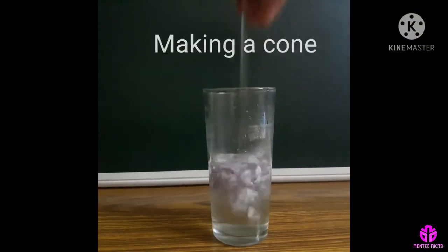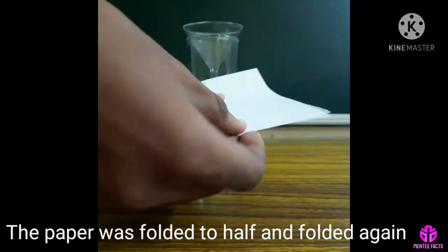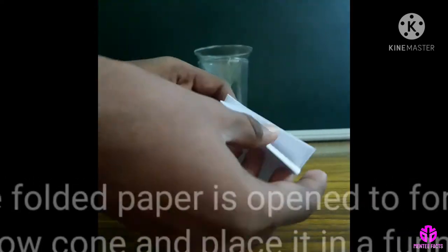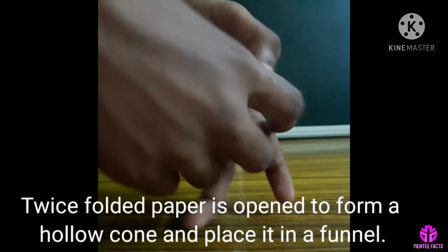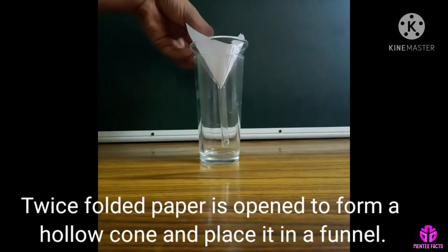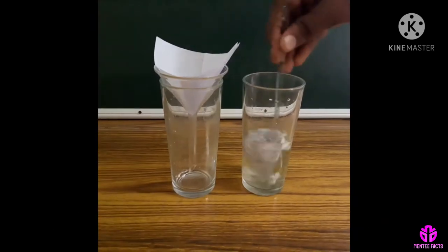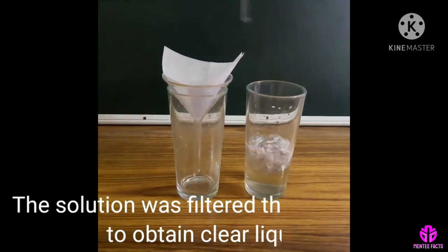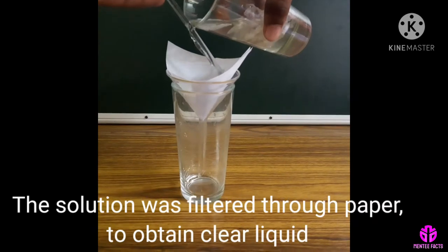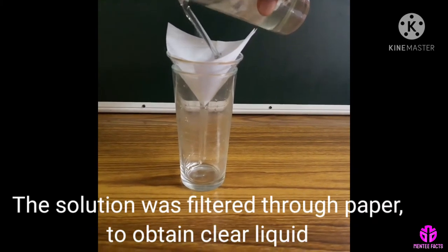Making a cone: the paper was folded in half and folded again. The twice-folded paper is opened to form a hollow cone and placed in a funnel. The solution was filtered through the paper to obtain a clear liquid.